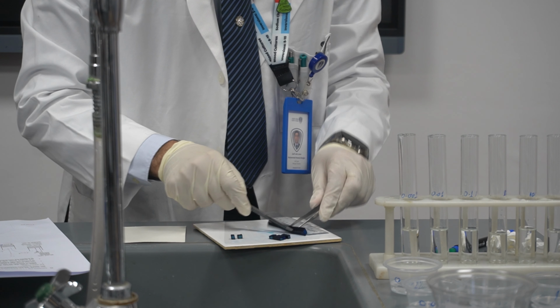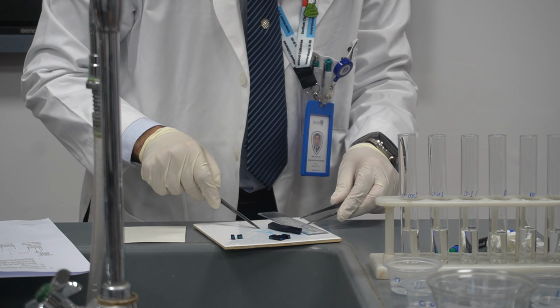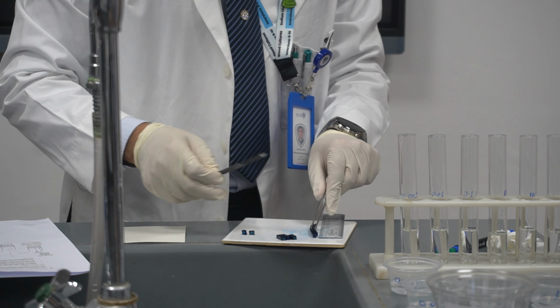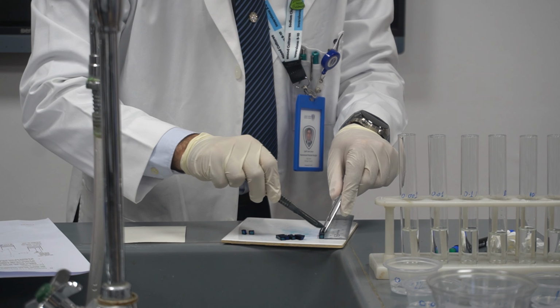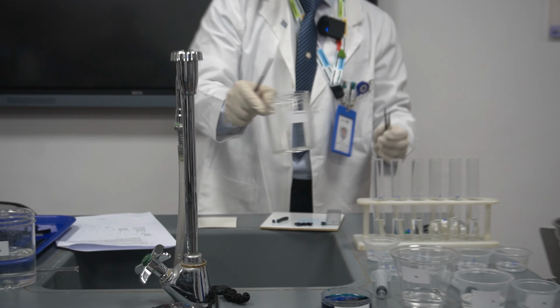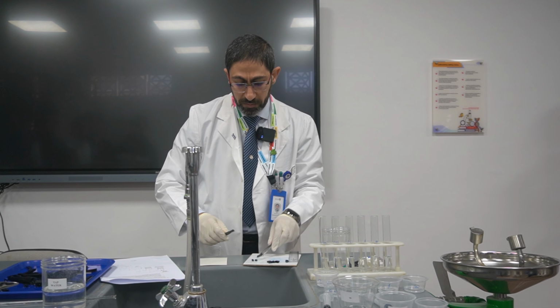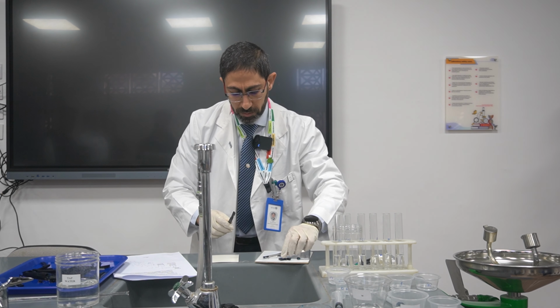I need 4 now. I have an additional 4. I need 4 more. Yes, okay. So here it is 1, and here it is another 1. Okay, so there is a waste. I can use it at any time. Afterwards, I don't need those. I can return this back, by the way. Those, not needed.